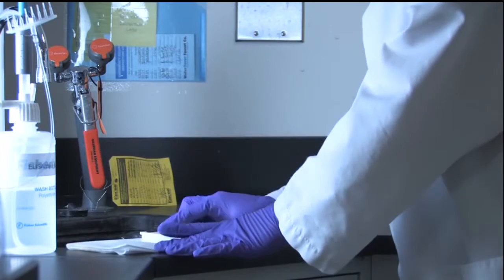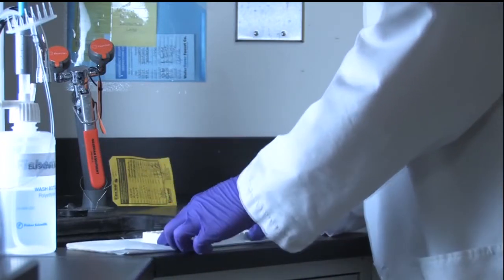Discard waste into an appropriate receptacle following the disposal requirements for your lab.